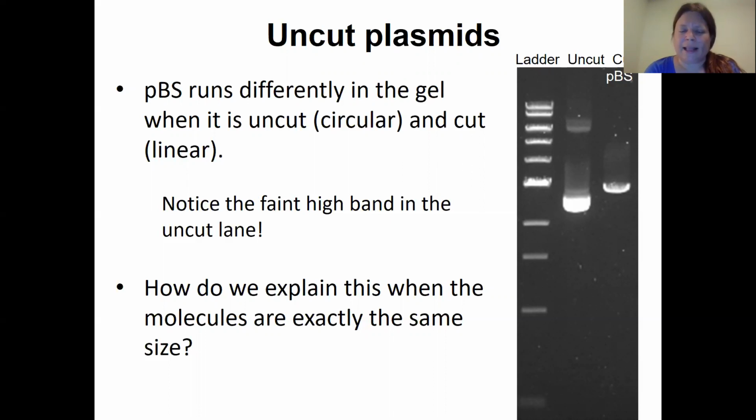If we look at the uncut lane, which in this case was not treated with any enzymes at all, again, it looks kind of weird. We've got 2 bands there, which shouldn't be happening because it's pBluescript that hasn't been cut with enzymes. It's all the same. It shouldn't show up in 2 places. We can understand maybe why circular DNA and linear DNA might run differently, but circular DNA and circular DNA also running differently might be a little unexpected. And the reason for that is that even circular DNA can have more than one shape.